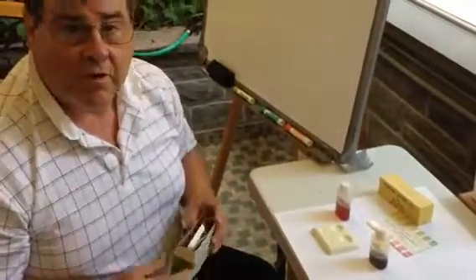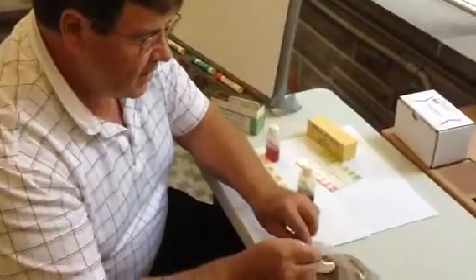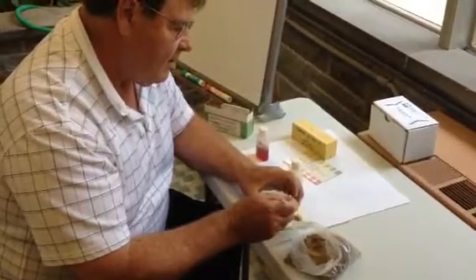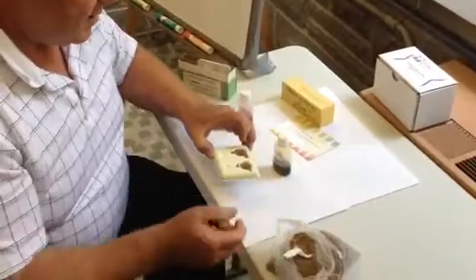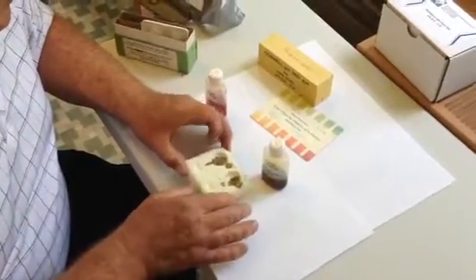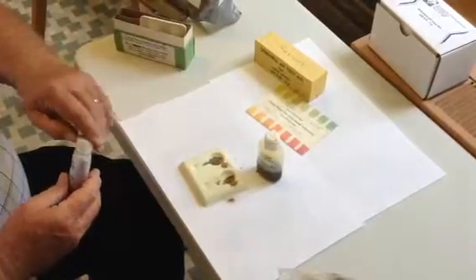When you start out, you really don't know what the pH is. So what I generally do is take dried soil and put a little in each vial. It really needs to be dried, because if it isn't dried, what you're actually testing is the water that is in the soil at that point in time.